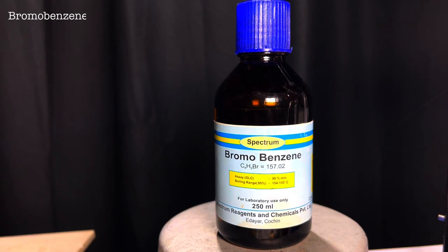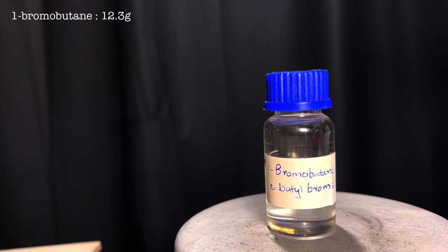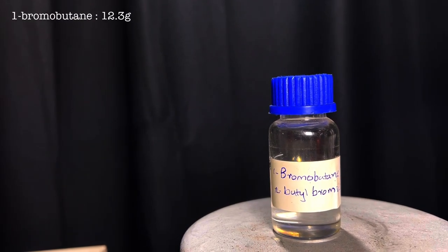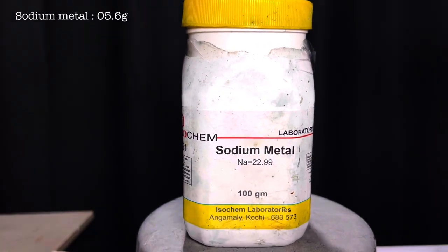For this synthesis we need 13 grams of bromobenzene, 12.3 grams of 1-bromobutane which I synthesized in one of my previous videos, and 5.6 grams of finely chopped sodium metal.